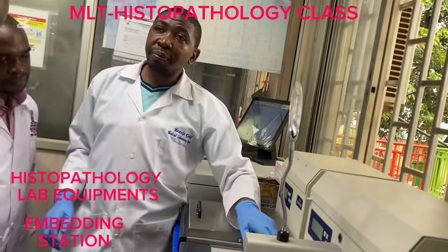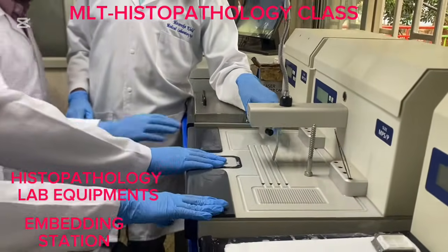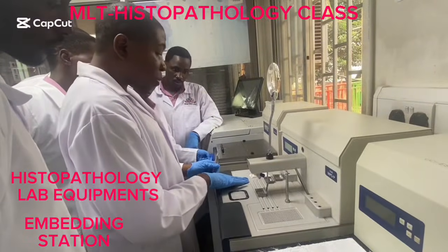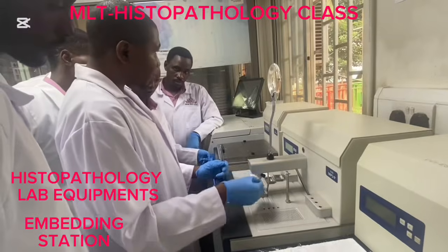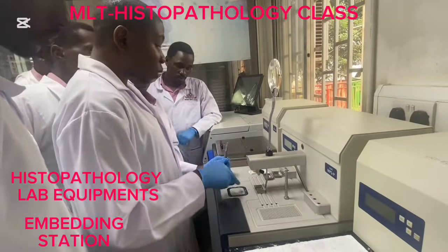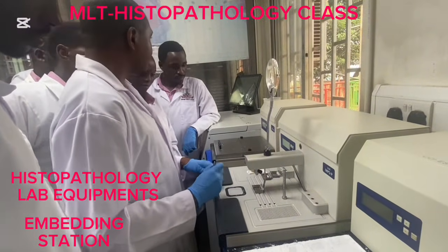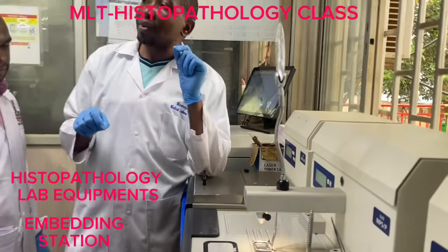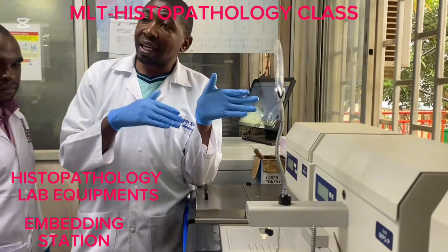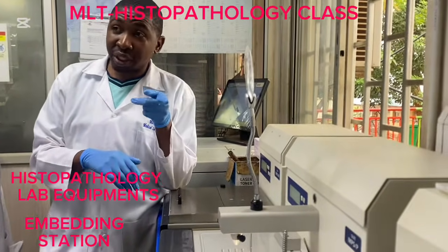The other important part is the warm surface. Let's touch here, the warm surface. This surface is warm to ensure that we keep the paraffin wax in molten state or liquid state. Okay, if it was cold, it would have solidified. So we won't be able to put the tissue into the paraffin. In other words, the first steps of embedding paraffin wax is in molten state, and the last stages it is in solid state because it's going to solidify.